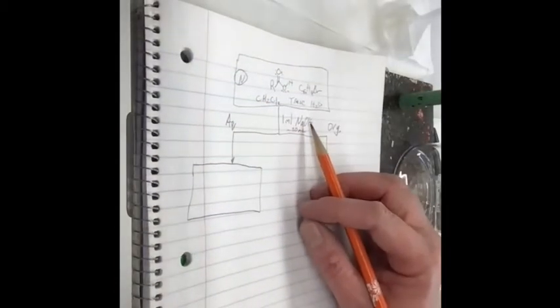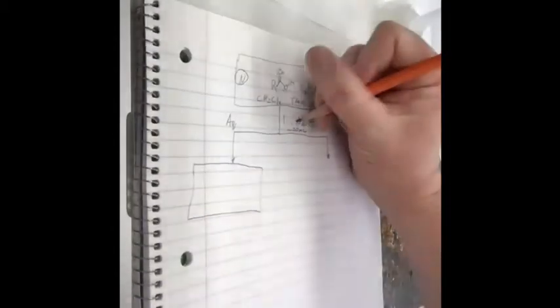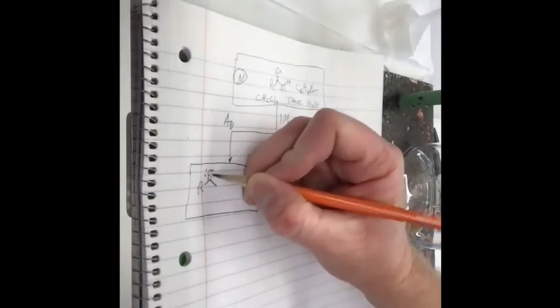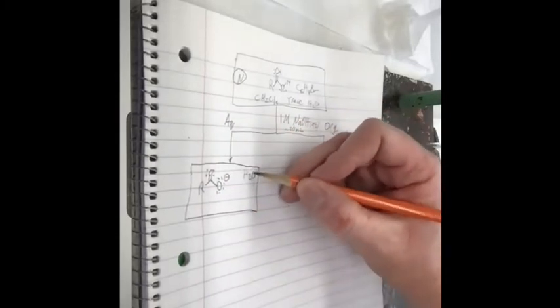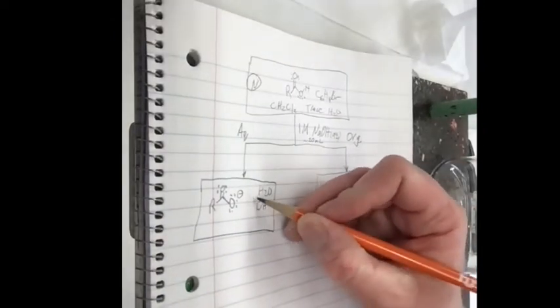If I do have the acid in the organic layer, will it react with 1 molar sodium hydroxide? Yes. It will, huh? So I'll get the carboxylate. That's one of our big 4 reactions. And why is the carboxylate over here in the aqueous layer now? Because it's charged. Yes. What else do I have in this aqueous layer? You have the water, hydroxide, and sodium. There you go. So let's try it.